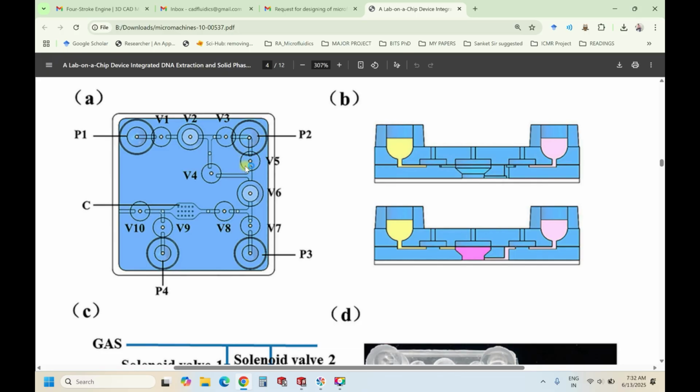Next let's create V5, V4 and these two V6. So we can create in the same way; P2 and P3 we can mirror. V1, V5, V6, V7 also we can create. So let's create that.